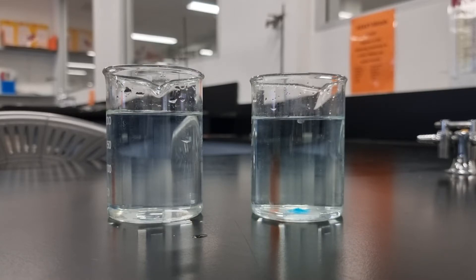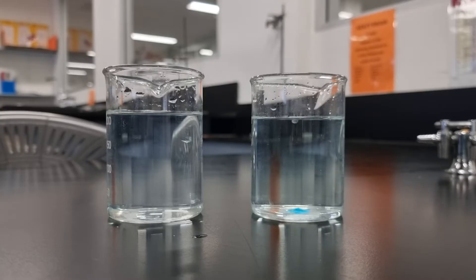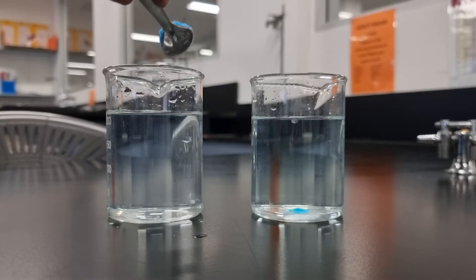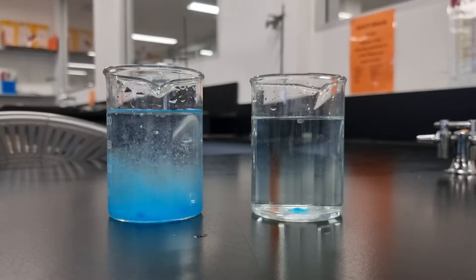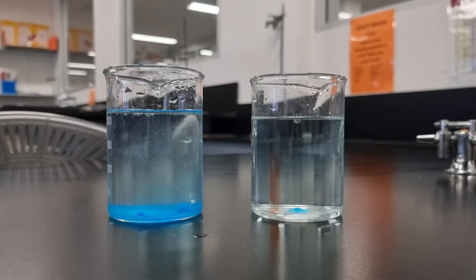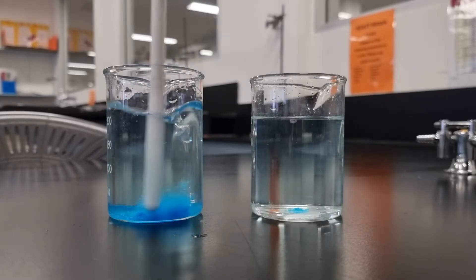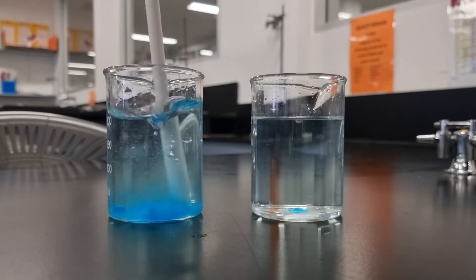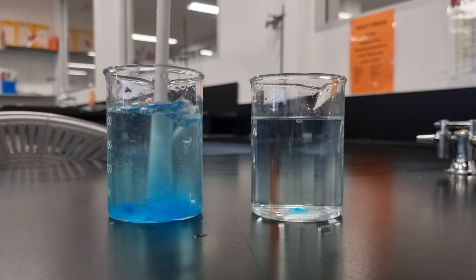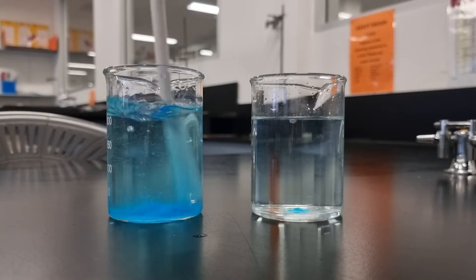If in the beaker on the left I put in more of the copper 2 sulfate and give that a quick stir, we should get a much more noticeable blue colour.